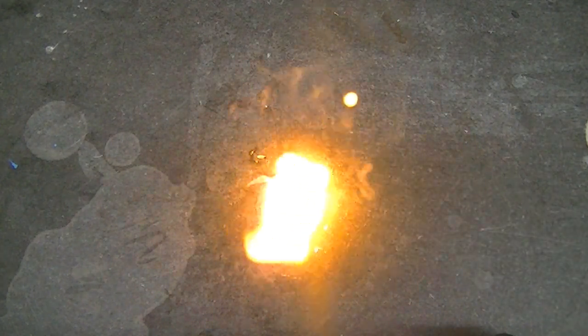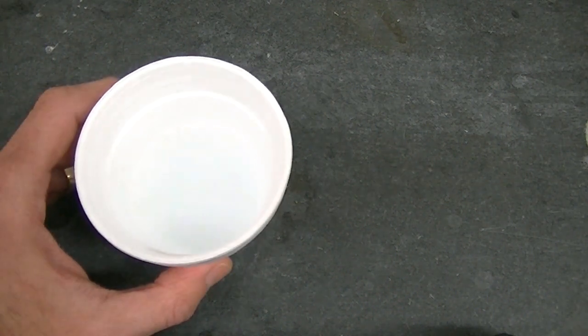Oh, you hear that pop? Well, I'd say liquid oxygen does a pretty good job of supporting combustion.